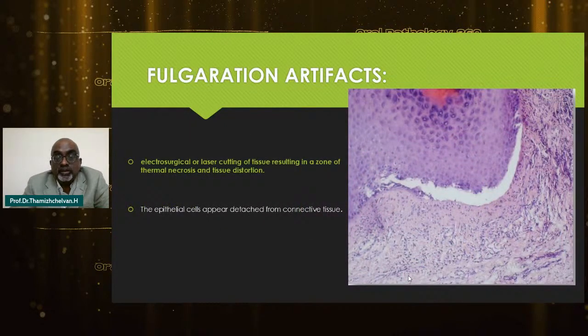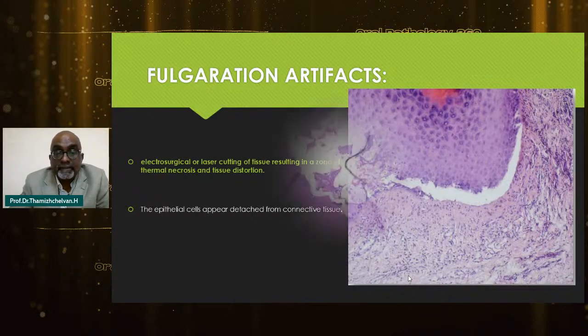Another common problem is that nowadays everybody has started using lasers and electrosurgery, because there's a procedure called the painless procedure. Normally in the clinic they give a spray and take a small incision, which is highly recommended and comfortable for the patient. But because of excessive heat, there can be a zone of thermal necrosis, tissue distortion, and the epithelial cells appear detached from the connective tissue, or the epithelial cells can come into the connective tissue, taking the appearance of a microcyst.